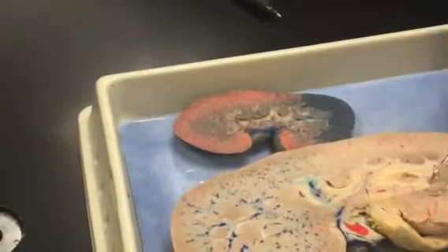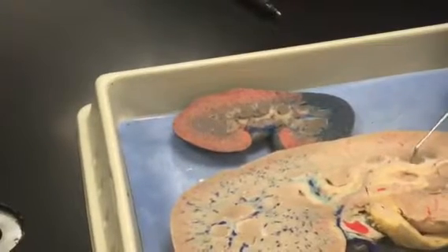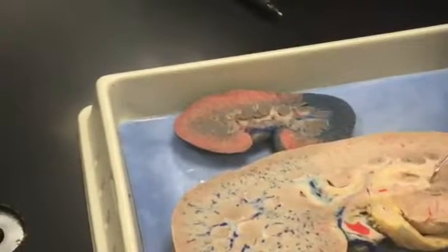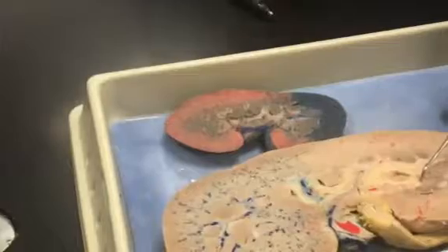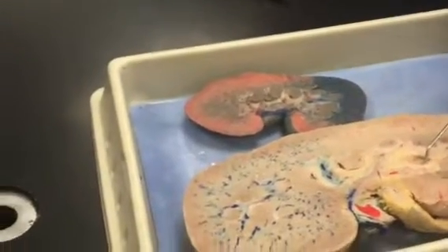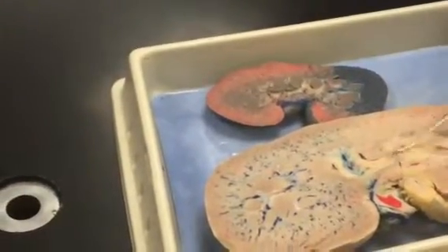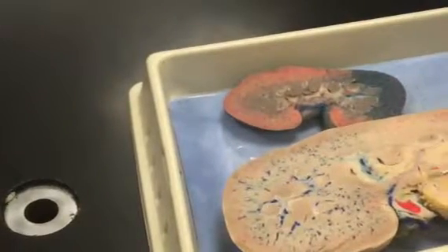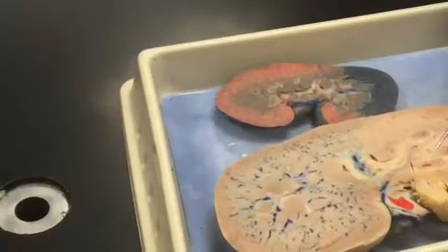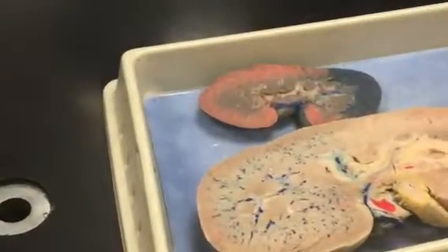The papillae are where the collecting ducts drip the filtrate right into that little space. All these little minor calyxes — all those minor spaces — run into larger spaces, which eventually all pool into this big renal pelvis, this big open space in the center. And then that leads to the ureter out to the bladder.